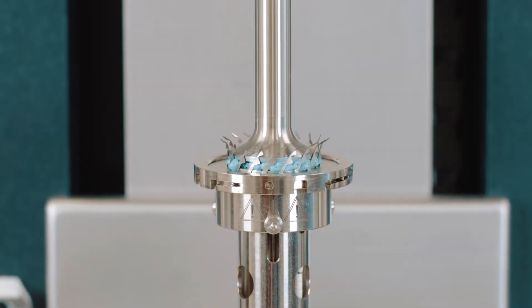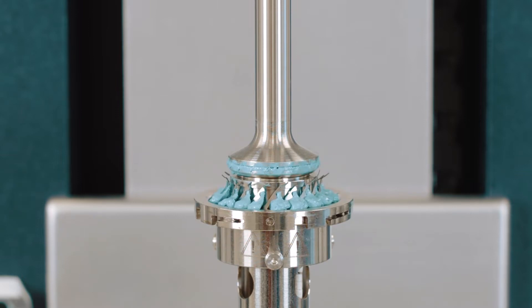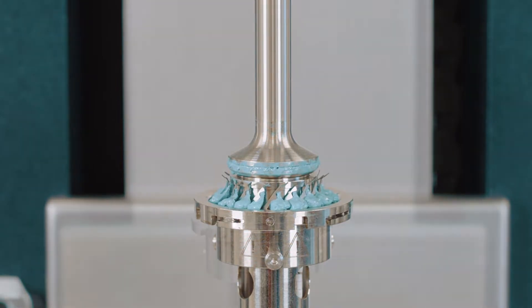The Auto Trim Accessory automates the sample trimming step in polymer melt rheology. Automating this step results in better data consistency and increases walkaway time for the user.